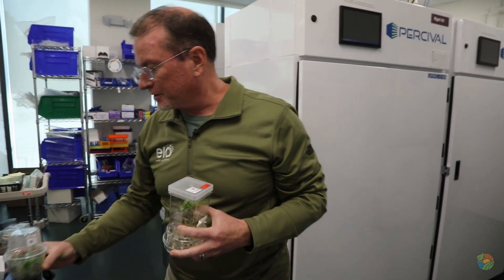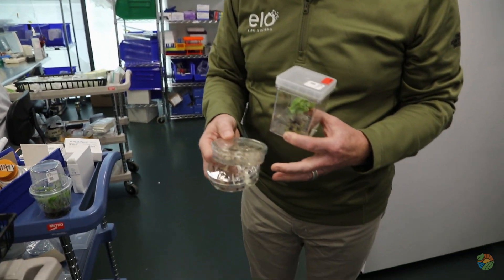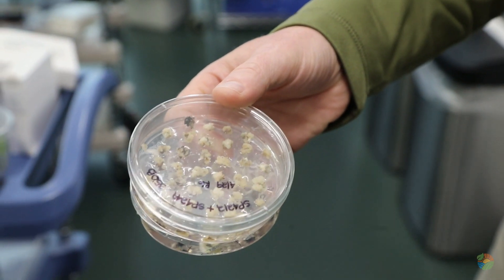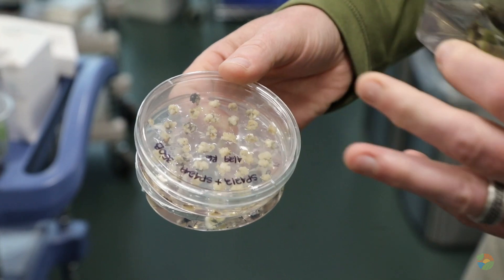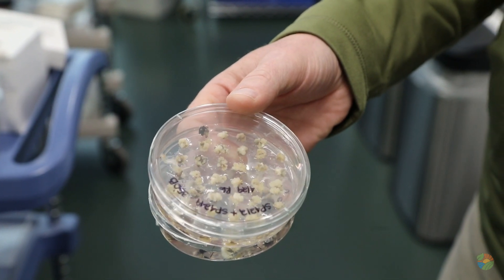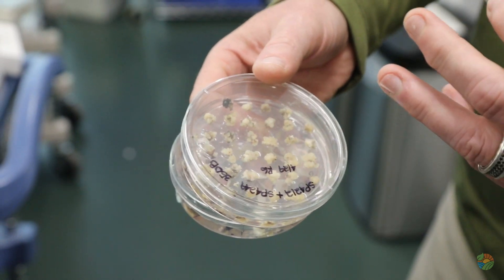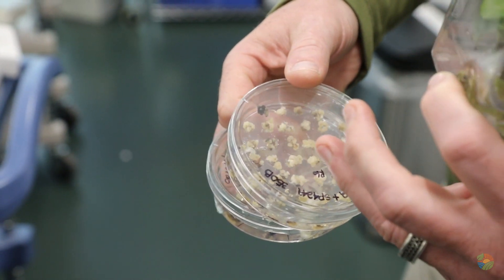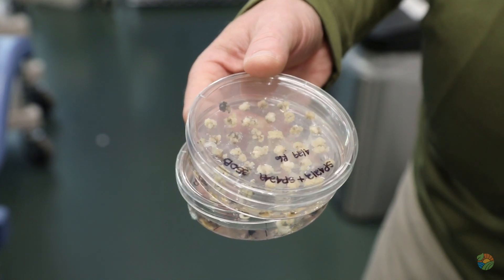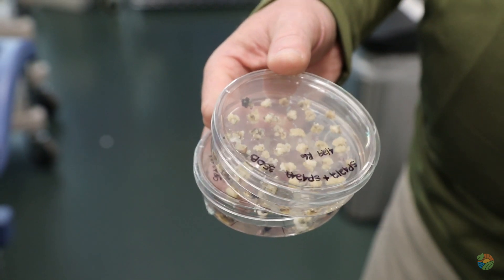Here are some different stages of what that looks like. I don't know if the camera is going to show this really well, but you can see the tissue that has started to grow back now from a single cell — this is life coming back. And on the far side of this plate, you can see the very beginning of a shoot that's going to ultimately grow all the way back to a plant.